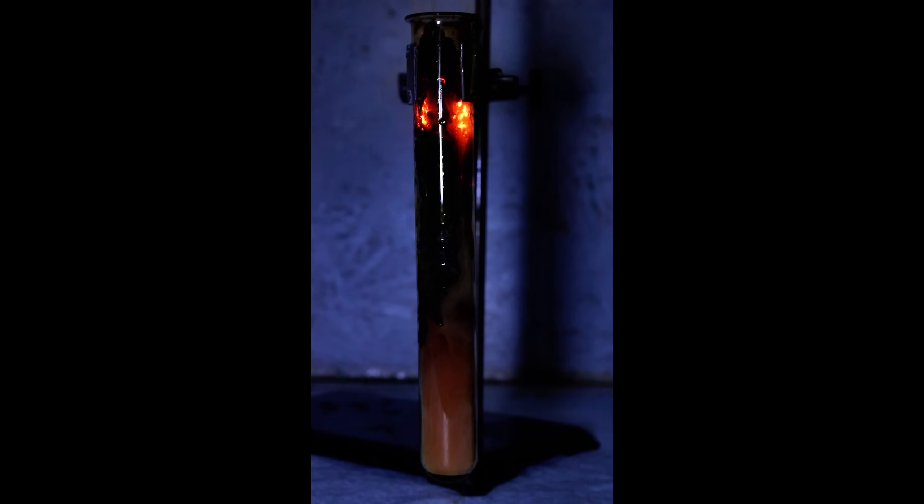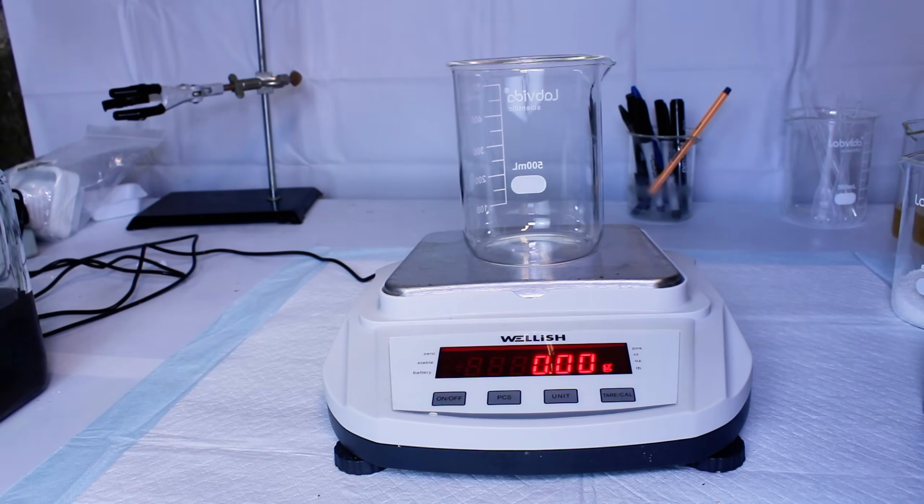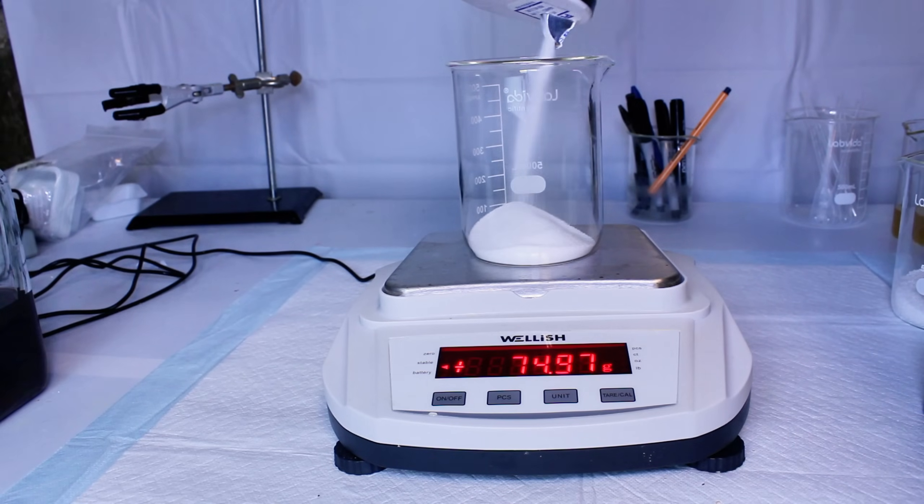Regardless, nitric acid of this purity is very, very obviously dangerous, and I never keep more than 20 milliliters on hand at any given time. Now that I've shown you one way to make nitric acid, let's move on to hydrochloric acid for a minute.